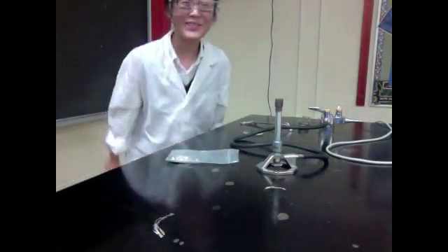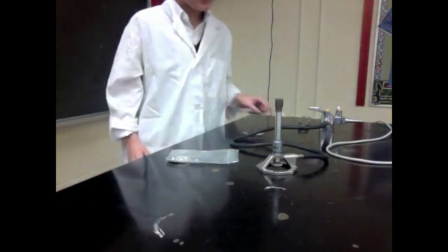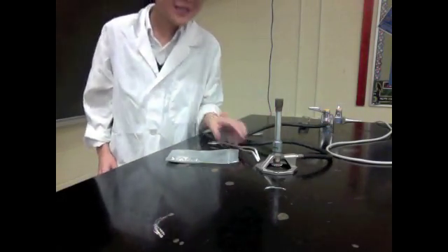Hi class, my name is Cindy. Today we're going to be doing the burning magnesium experiment.